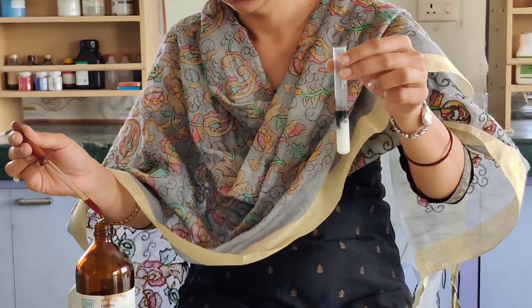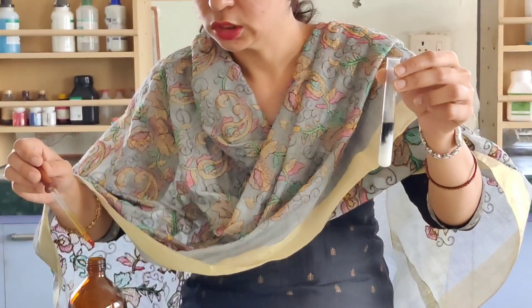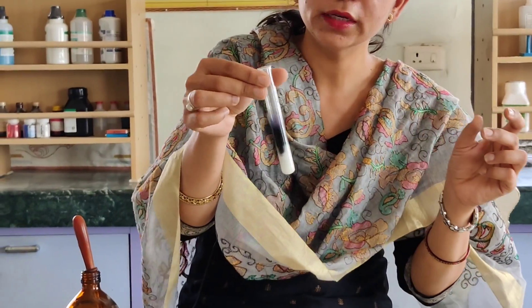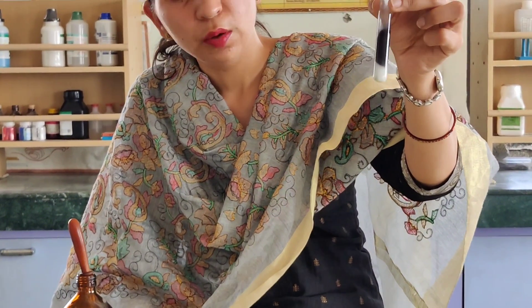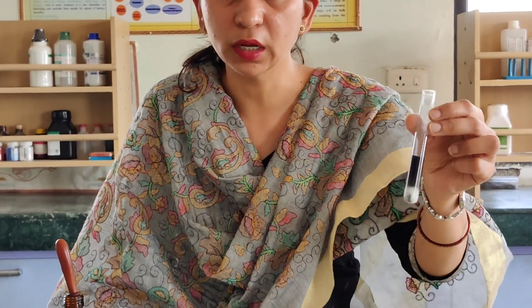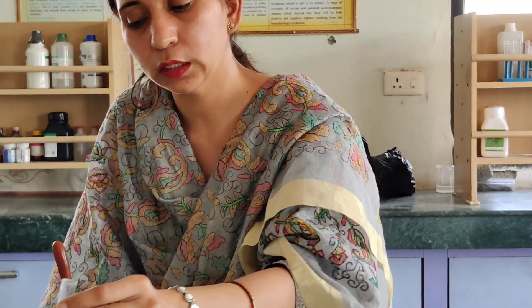You can see that a blue-black color appears. When starch reacts with iodine solution, it shows a blue-black color, confirming the presence of starch. This is our first activity — we have seen that starch reacts with iodine solution to produce a blue-black color.